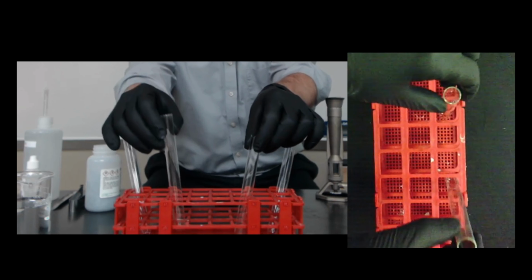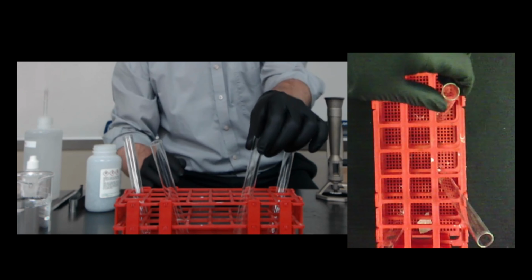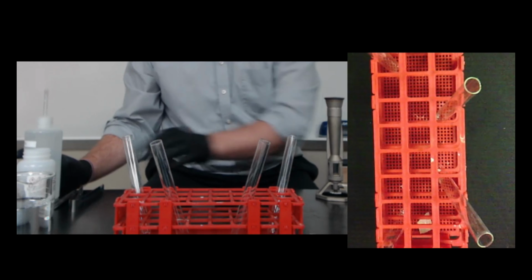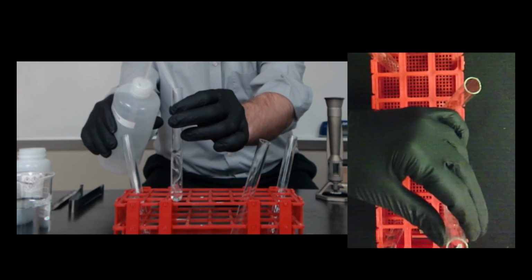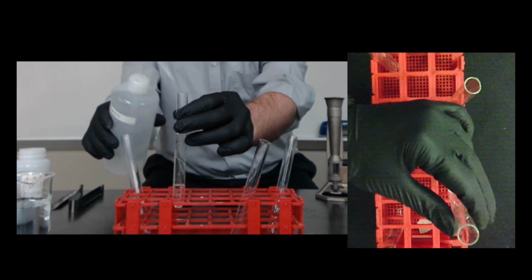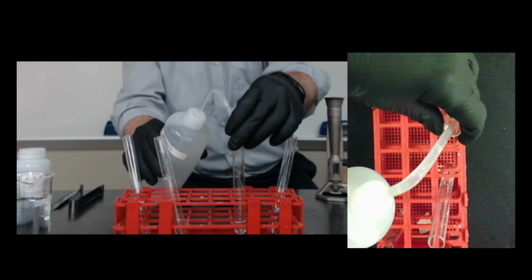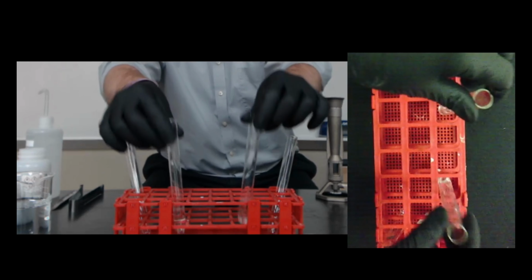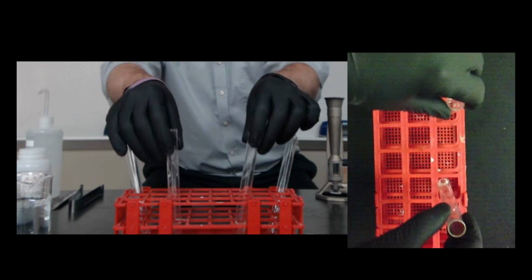In my test tubes, this is going to be magnesium right here, and this is going to be calcium. We're going to first start with the reaction with water. I'm going to take some distilled water and add a few milliliters into my test tubes. The reason we use distilled water is that it doesn't have any minerals in it. It's just the water. As you can see, nothing in there but water.